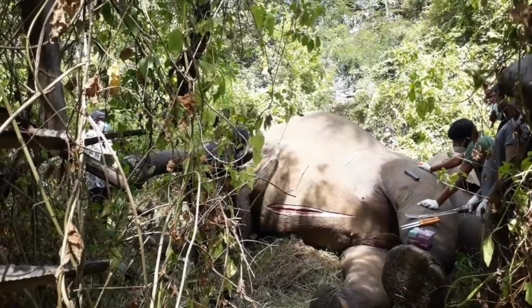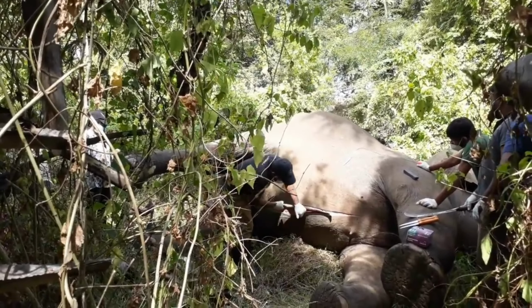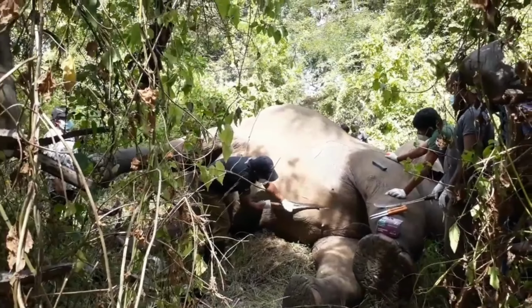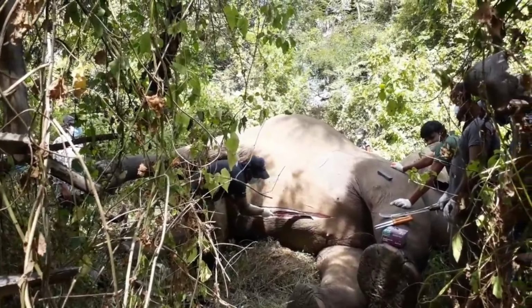At this point, I'm removing the organs carefully to inspect them. The intestines appear a bit bloated, which is normal postmortem due to gas buildup. There are no obvious twists or tears in the intestines, but we'll keep looking for signs of damage.